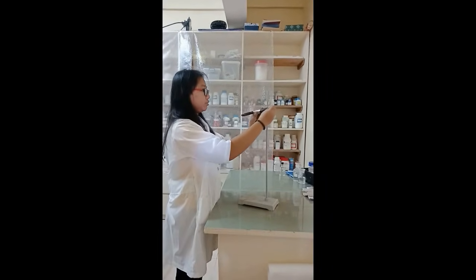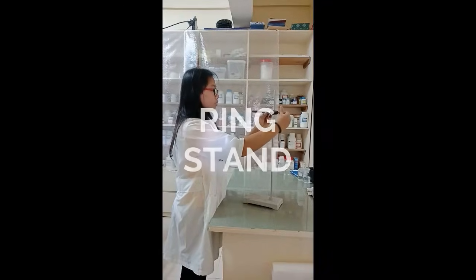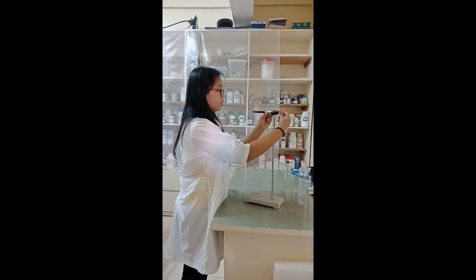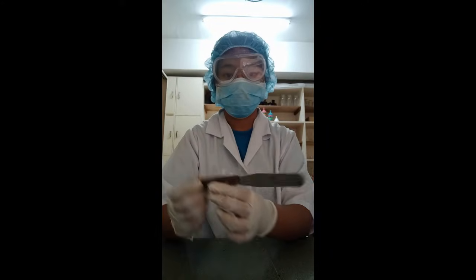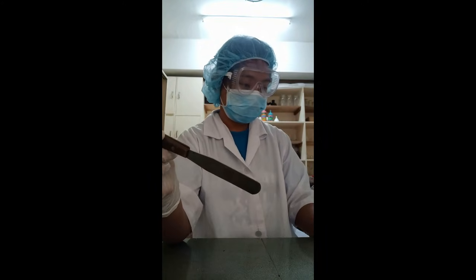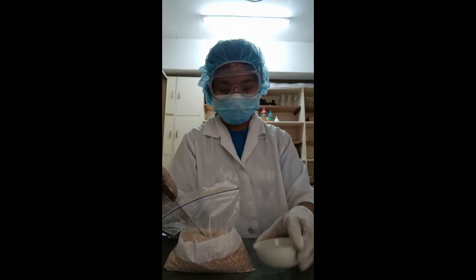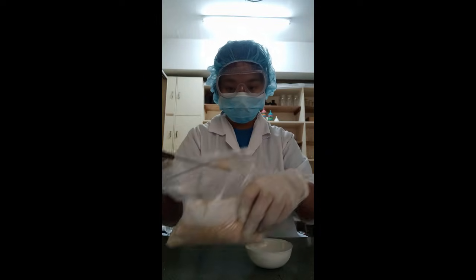Ring clamp. It is used to clamp onto a ring stand to seat a beaker or a flask. Ring stand. It is a stand used to support a ring clamp, iron clamp, and burette clamp. Spatulas. It is used to scoop solid chemicals out of the original container onto a weigh bottle so that it can be weighed on a balance.